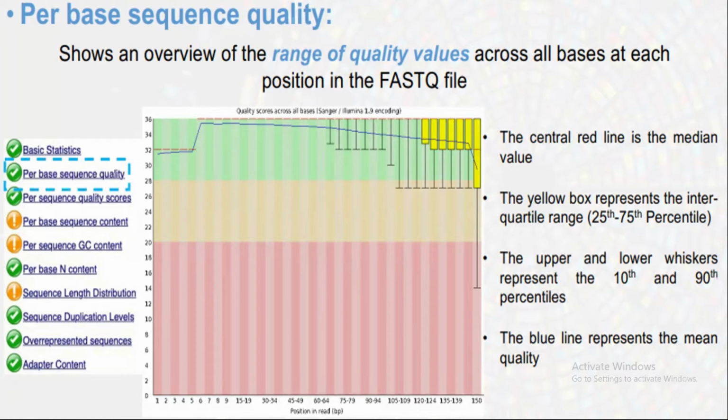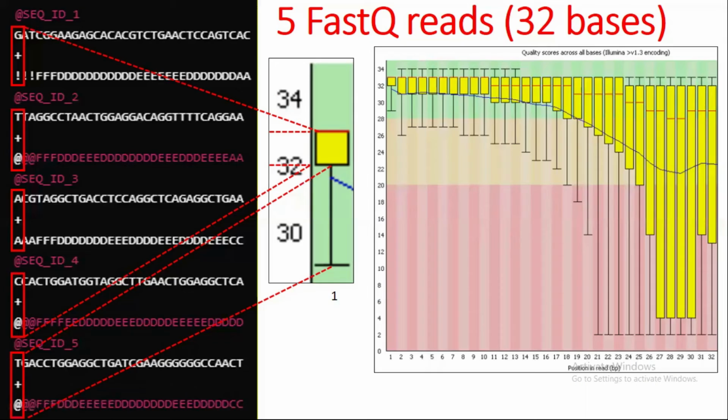So I hope you get my point. If you know how to interpret it, then here reads 28 to 32 have compromised quality, so now you can deal with it. I will show you how to deal with it in a later video, in part 12 of this video series. Here I just want you to understand the results.